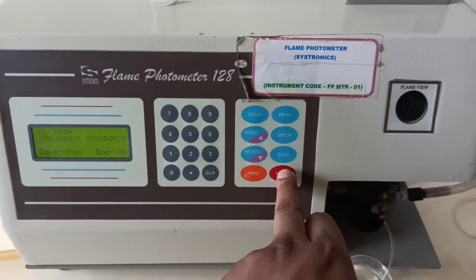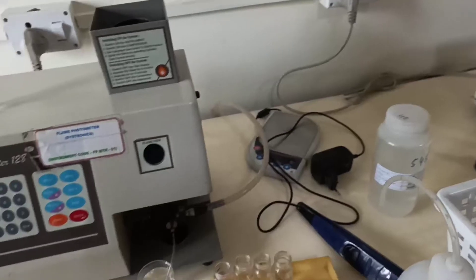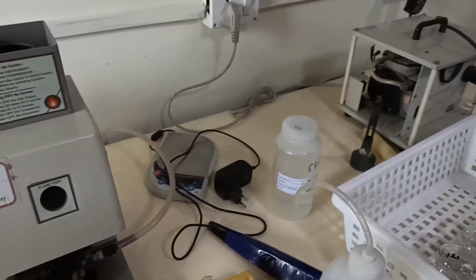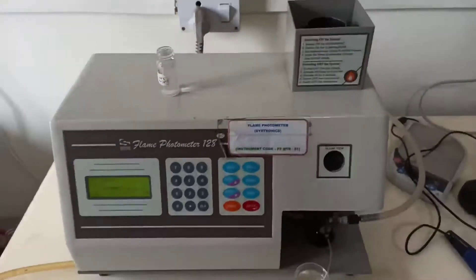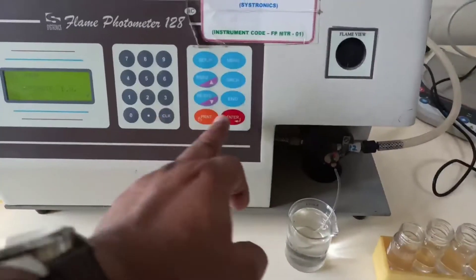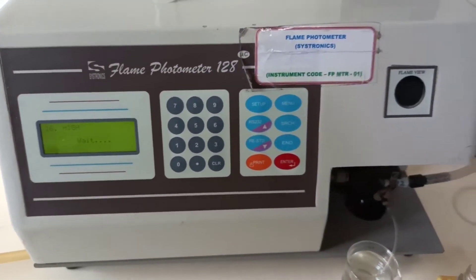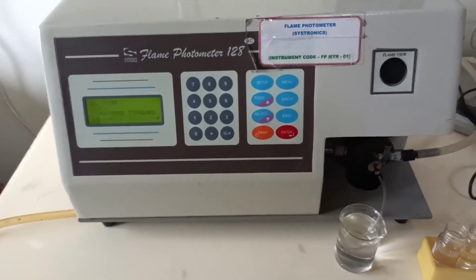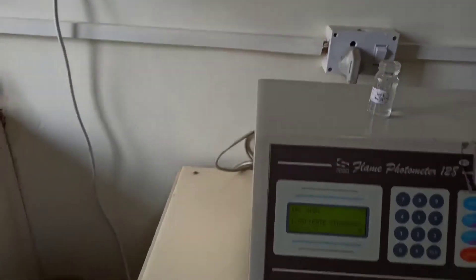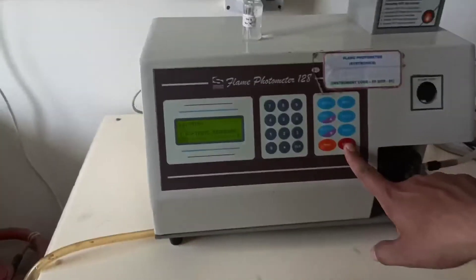We press the button to confirm yes. Now we aspirate the standards in descending order, as I told you, and rinse with distilled water between each standard. I press enter and the instrument instructs us to aspirate with distilled water first, then aspirate with the standard. Now we are taking our first standard, dipping the nebulizer inlet into it. You can see the flame color has changed — I will show you. We press enter and the instrument goes to the wait process.